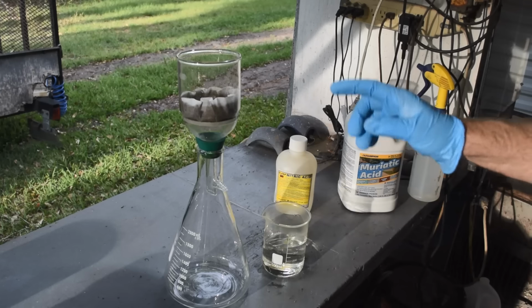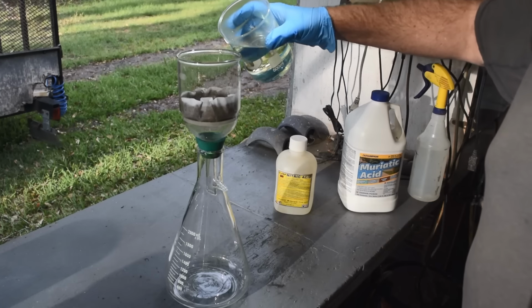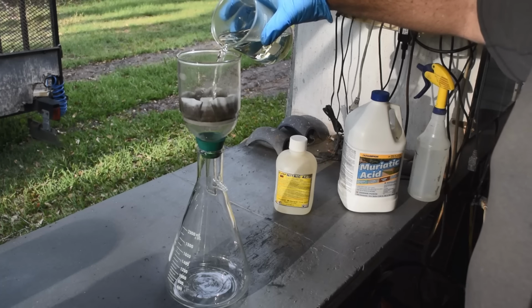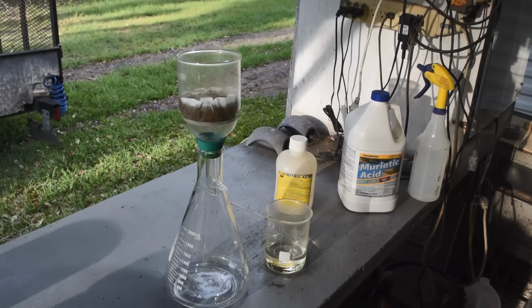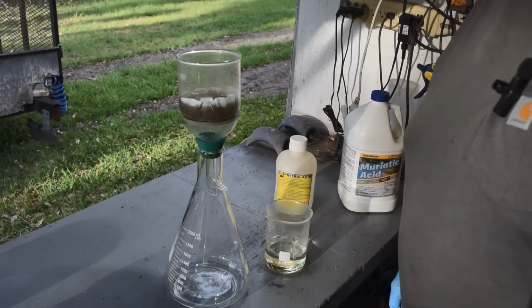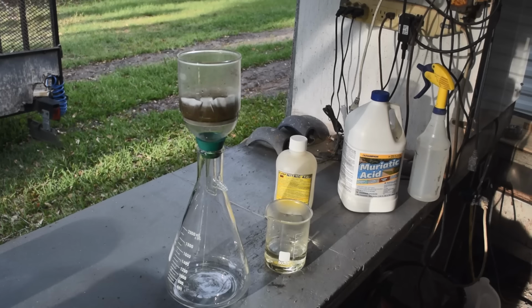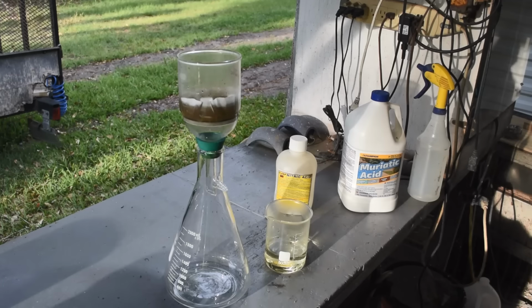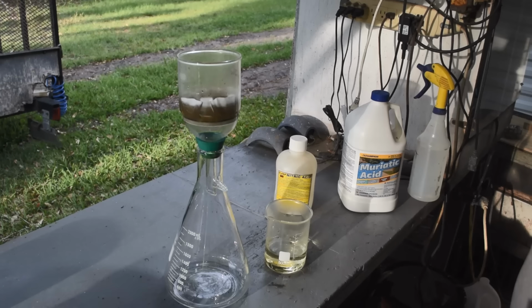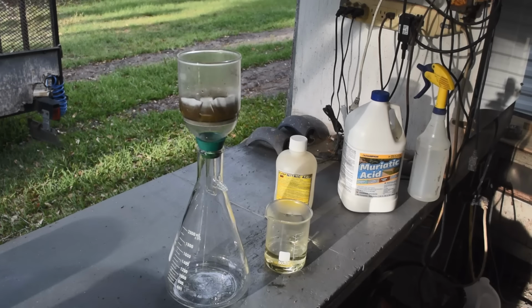But the reason I'm making it strong is it's not going to be resident on the gold for very long. I'm going to do what I did before. I'm going to pour it through and let it drip through on its own under gravity. And it should dissolve that gold on its way. A little bit of reaction in there. It should start dripping through. There it goes. So far it's coming through pretty clear, but hopefully it'll start looking like it's got gold dissolved in it.